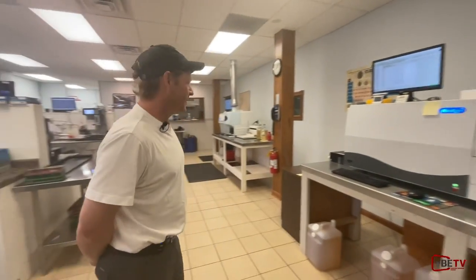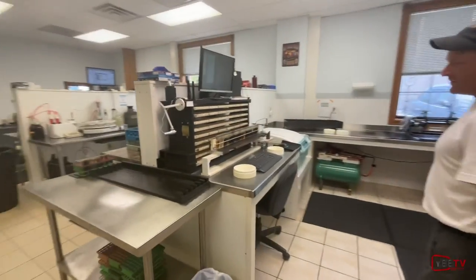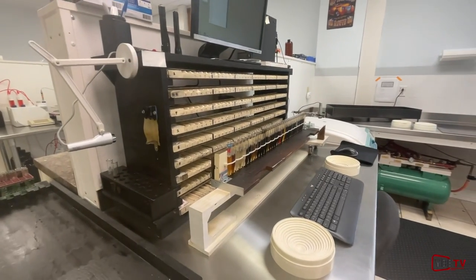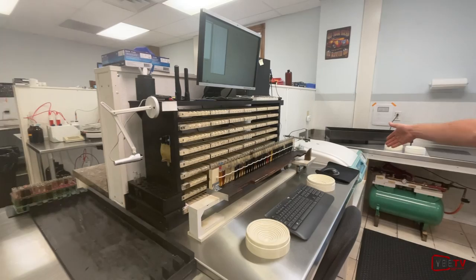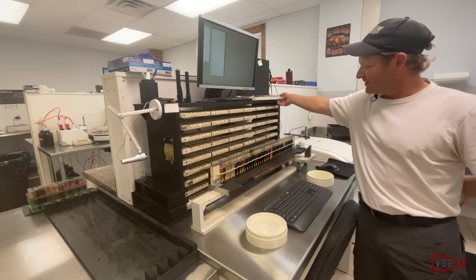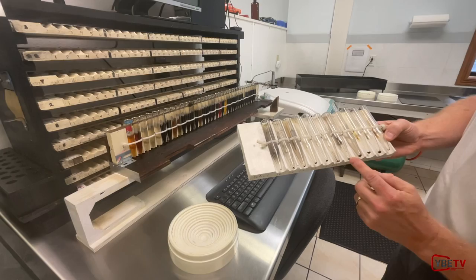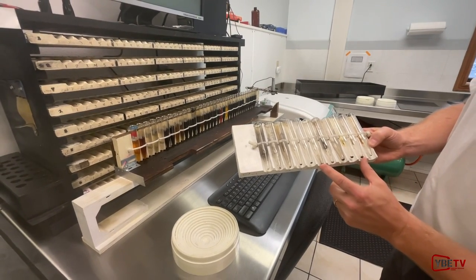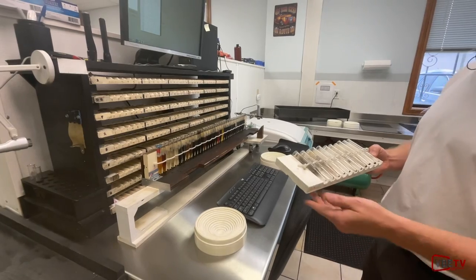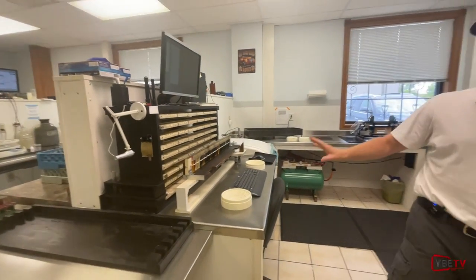Another standard test is the insolubles test — a centrifuge test. We take five milliliters of oil and mix it with five milliliters of petroleum ether as a solvent, shake it up, heat it, and run it in the centrifuge. Then we look at the amount of solids that have spun out. There are normal levels of solids and problem levels. This basically tells you how dirty your oil is — if there are too many solids, maybe the oil filter isn't doing its job or the engine is producing more solids than the filter can handle.